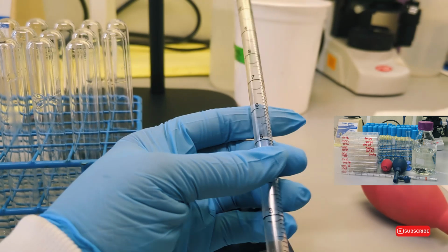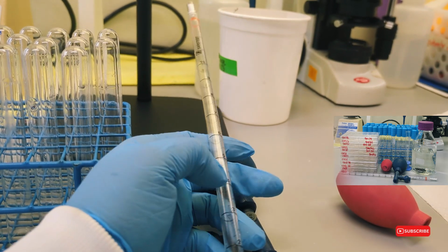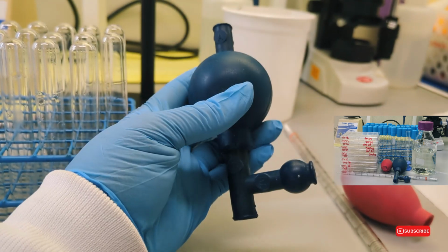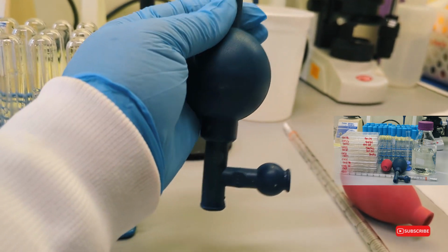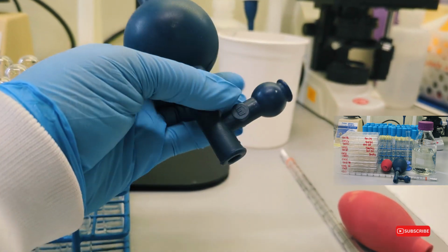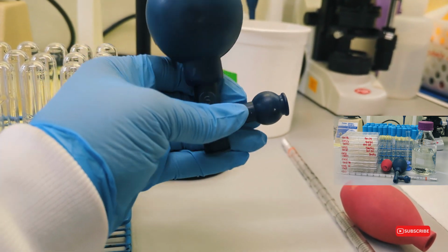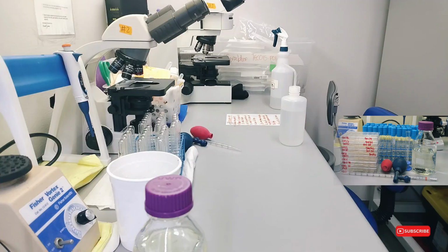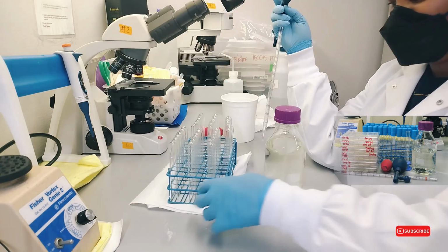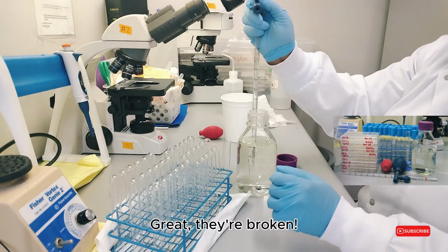The automated pipette fell and broke on Wednesday, so I had to go look in the chemistry lab. Hopefully, I remember how to use it. I think you pull it up and then you release it from here or here. We'll see. Great. They're broken.